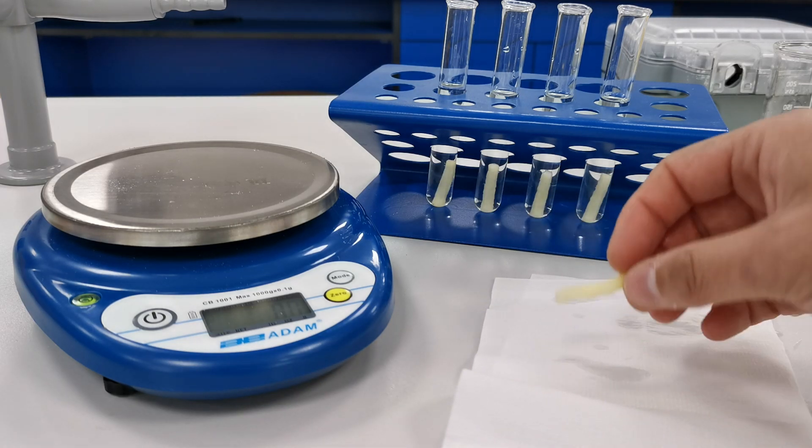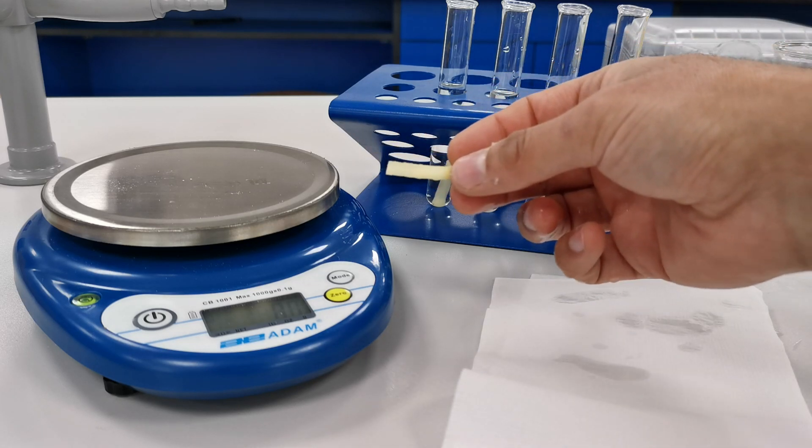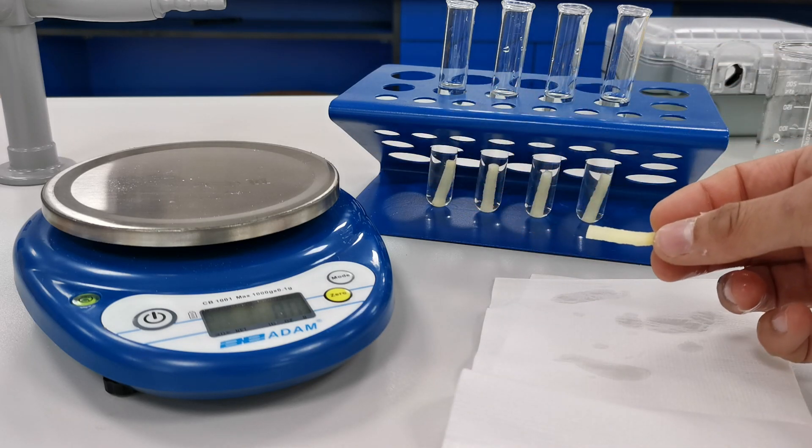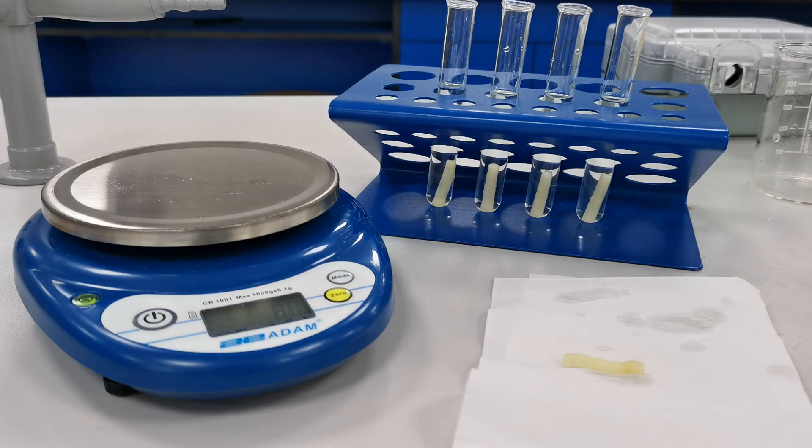And then I'm going to use the mass balance to measure the mass of the potato cylinder again and record the results in the table.